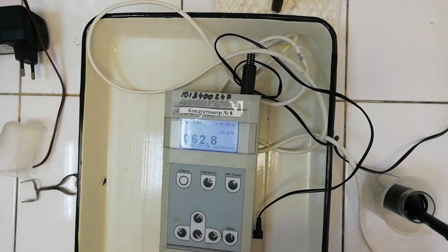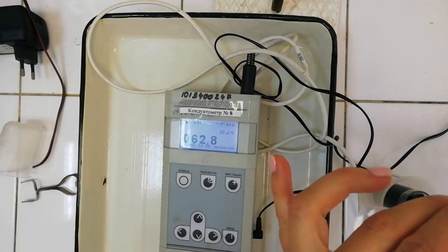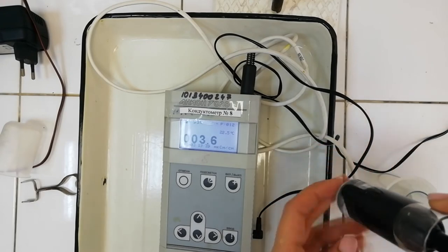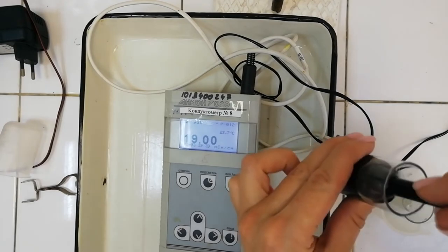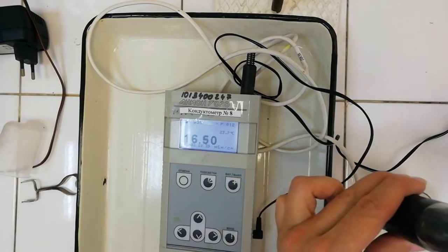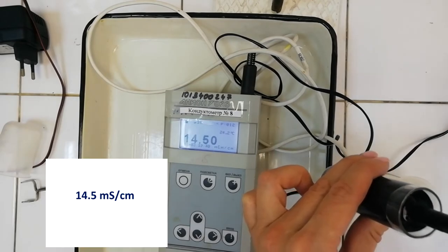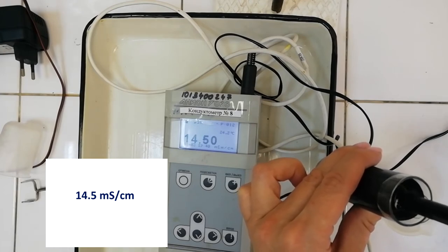Now we measure the electric conductivity of the new solution. We pour it into a glass, put the electrode inside, and look at the reading on the measuring unit. We fix the number: 14.5 millisiemens per centimeter. Please write this number in your report.